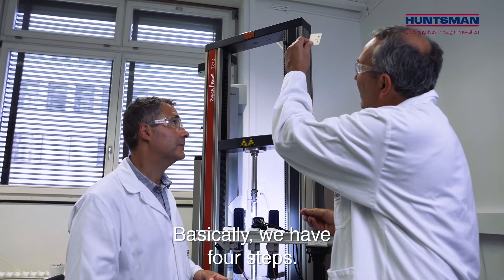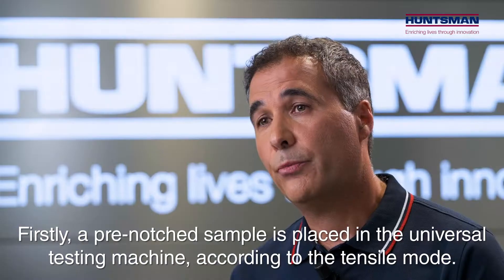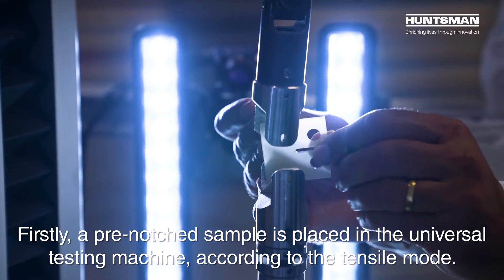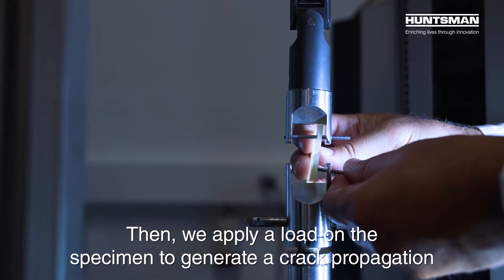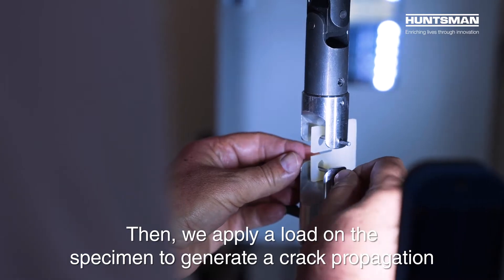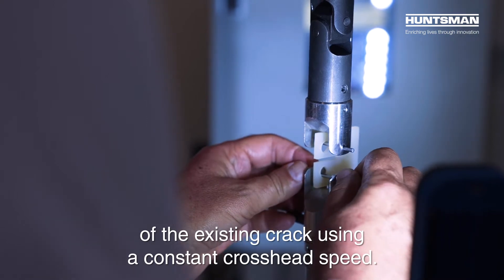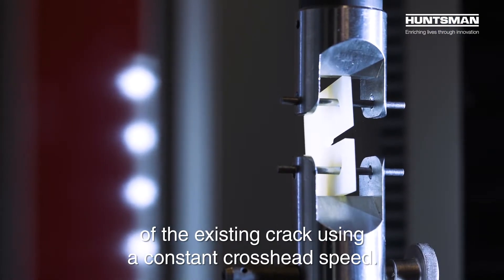Basically we have four steps. Firstly, a pre-notch sample is placed in a universal testing machine according to tensile mode. Then we apply a load on the specimen to generate crack propagation of the existing crack using a constant cross-head speed.